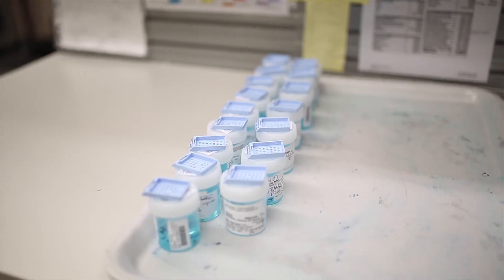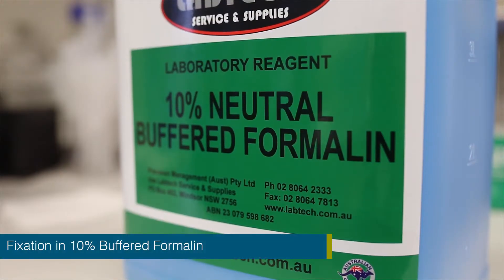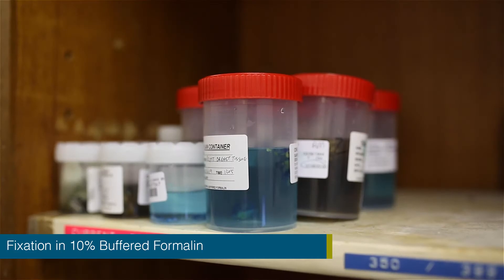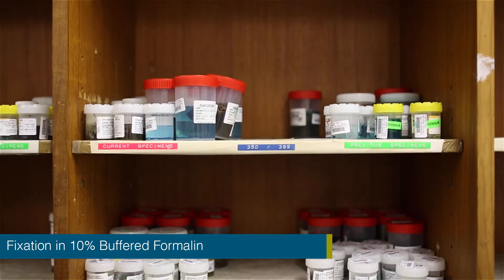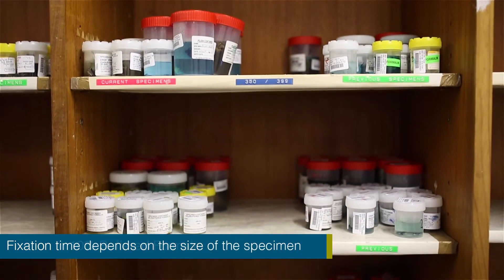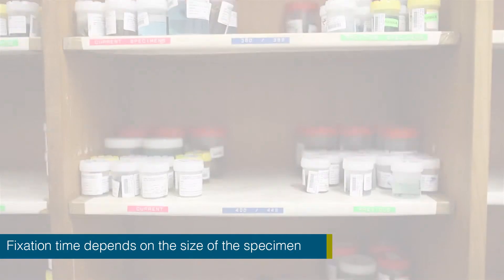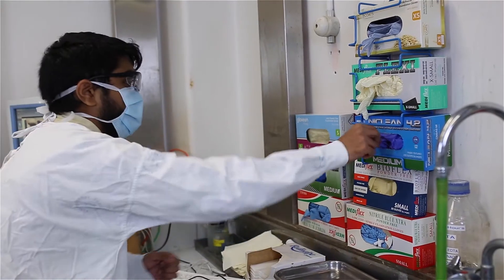Depending upon the specimen type, the specimen is then allowed to be fixed in 10% buffered formalin between 5 hours to 24 hours. Smaller pieces of tissue will require less time in fixation compared to larger resection specimens.